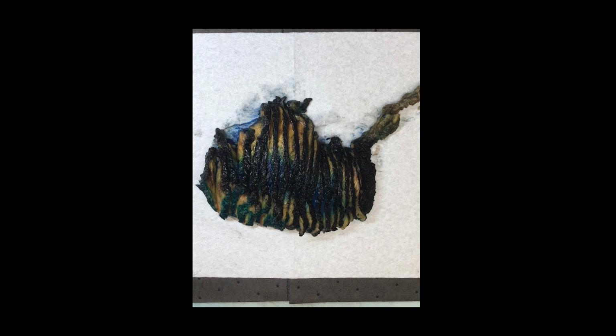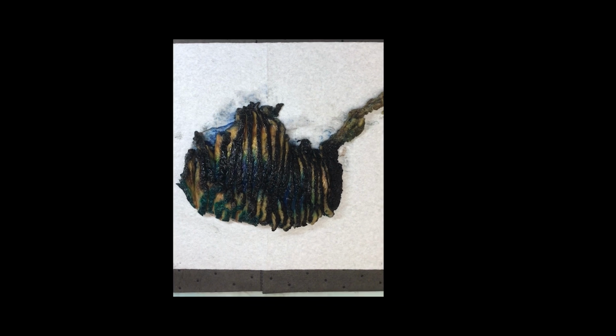Also, go with enough pressure to get all the way down to the skin so that you don't have to go back and make multiple additional cuts through the same slice. That will help you make the slices very smooth and even. I would also suggest going faster rather than slower. If you go slow, you can sometimes get hesitation marks throughout the tissue, and that will lead to uneven slices again.